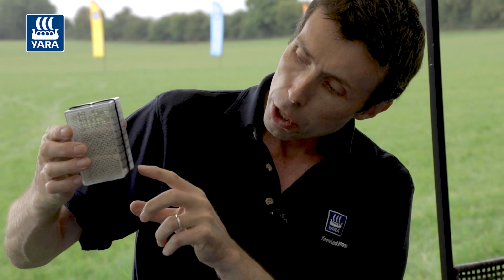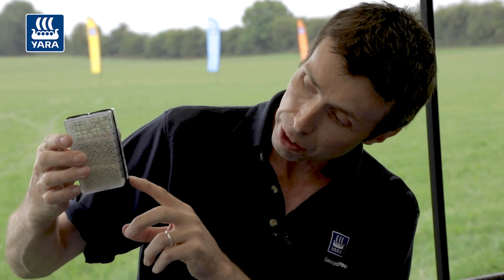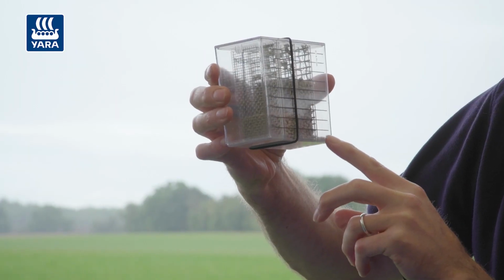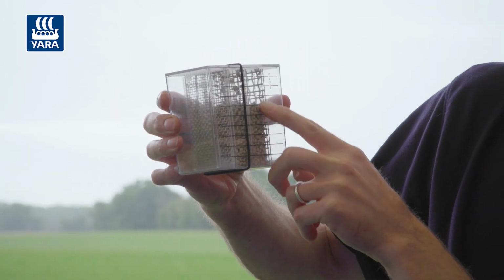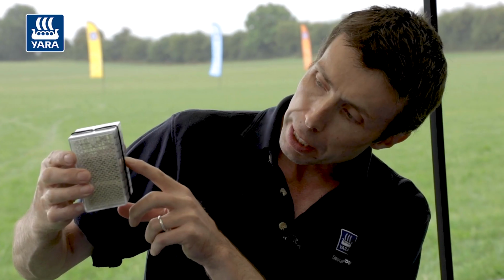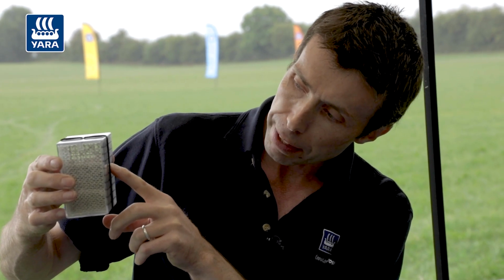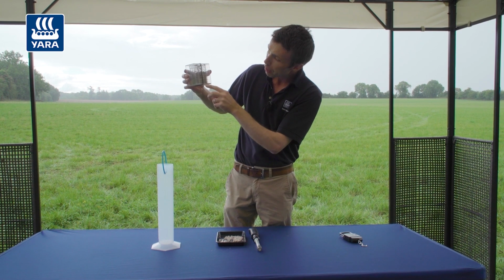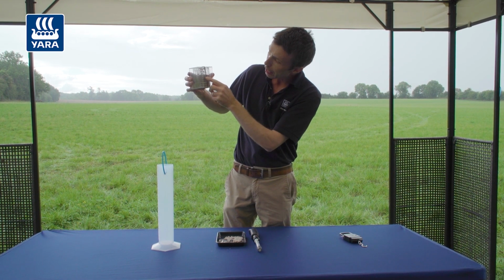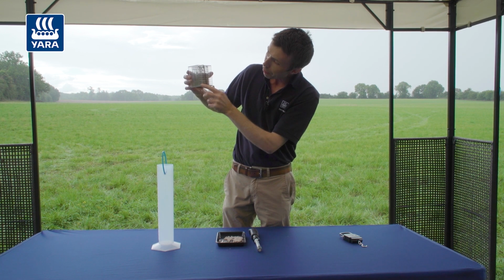We can see here, with particles with a diameter greater than 4.75, there's probably 2 or 3% there. And this is the desirable range here, 3.3 to 4.75. We can see that we've slightly more than 60% there, maybe 62 or 63% falling into that size category. Then for the next size category, between 2 mil and 3.3, it's around about 25%, and then we've none at this 2 millimeter size.